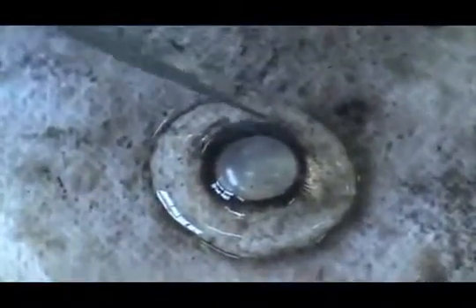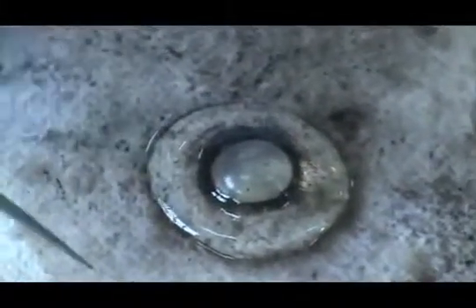This is the suspensory ligament, which is the black tissue. And this is the lens. The suspensory ligament stretches and relaxes the lens in order to focus on far and nearby objects.